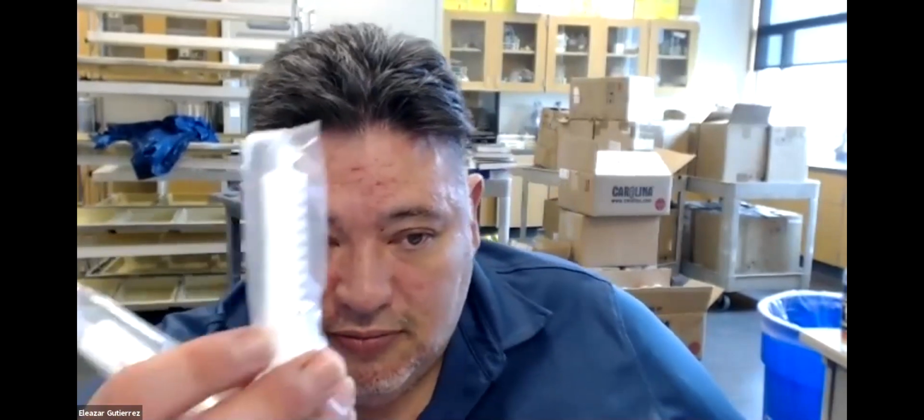Okay. Once your syringes are ready, okay, you're going to take your light source, and you're supposed to put it about 10 centimeters away. It depends what kind of a light source it is. Okay, be careful. If your light source is LED and it doesn't produce a lot of heat, then 10 centimeters is going to be perfect.